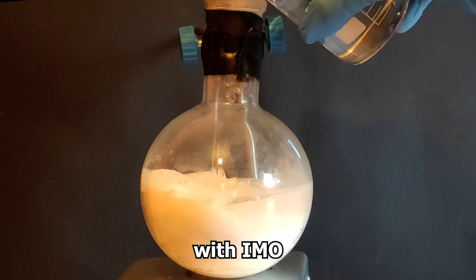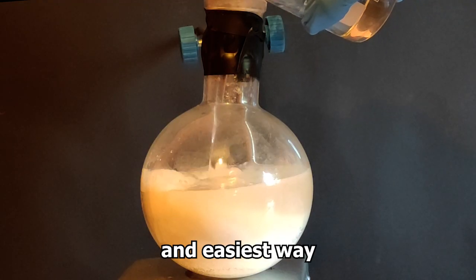Today we're going to make some nitric acid with, in my opinion, the most efficient and easiest way to make it.